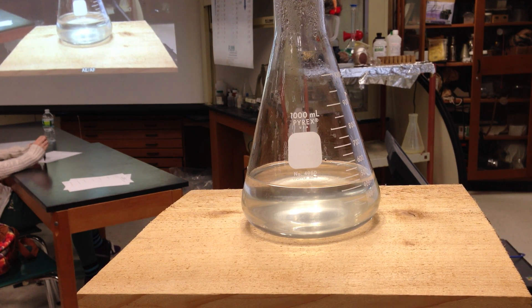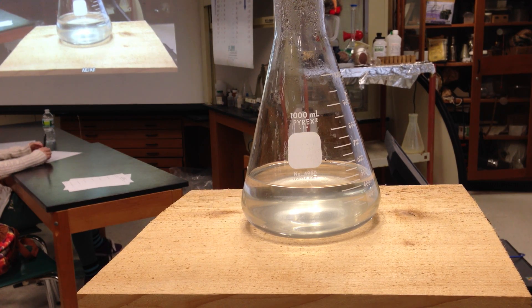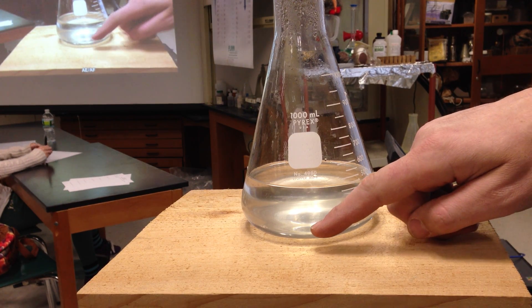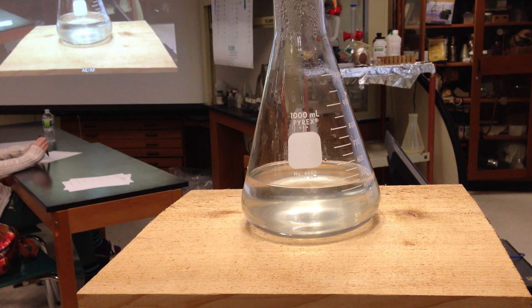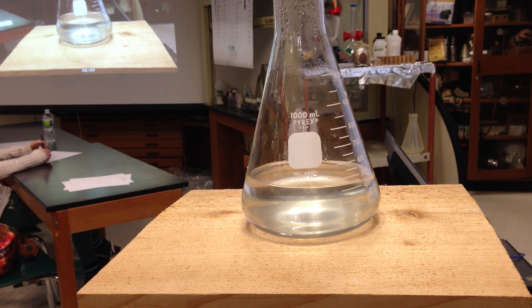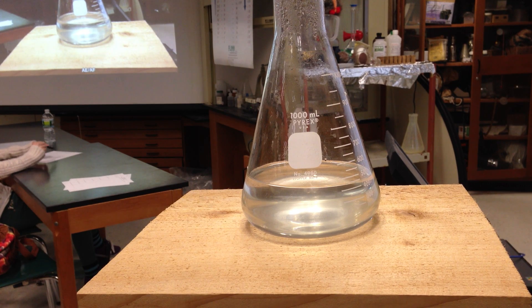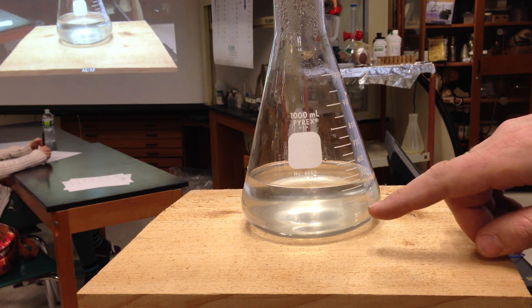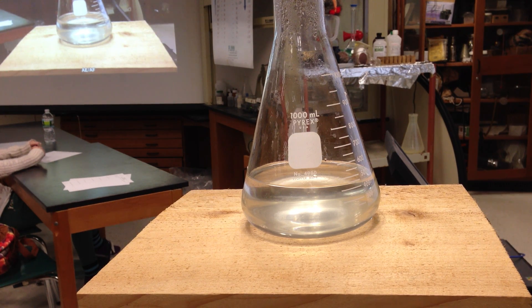What I'm going to do is I'm going to put a couple of crystals of sodium acetate right next to the Erlenmeyer, and as I pour, those seed crystals are going to be essentially organizers. They're going to help the sodium acetate arrange itself. Because right now what I have is a soup of acetate and sodium ions.